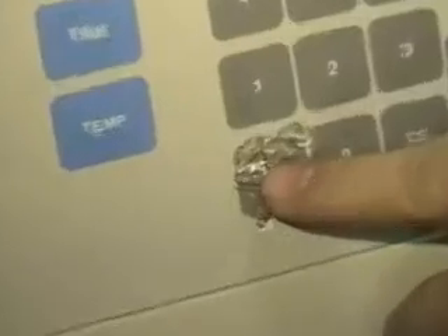The button that we spoke about earlier is right here. It's the plus-minus button that changes the negativity or positivity of the numbers. And it does work. Look, it's just a little ripped.